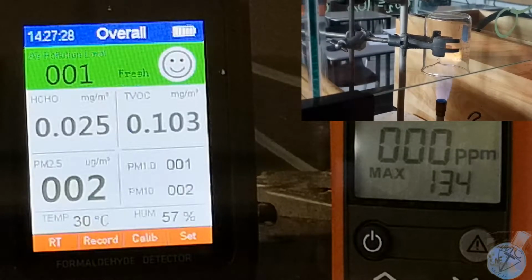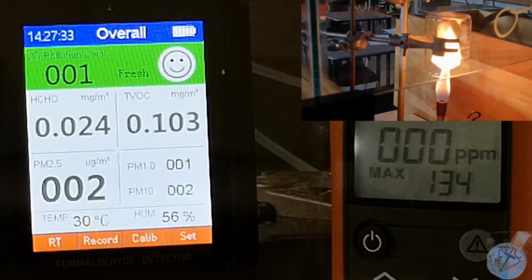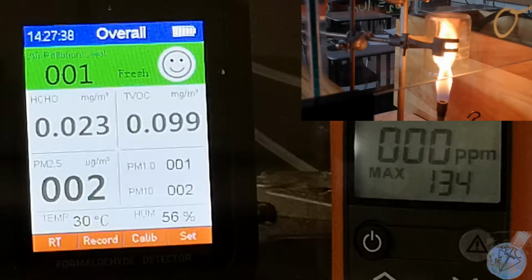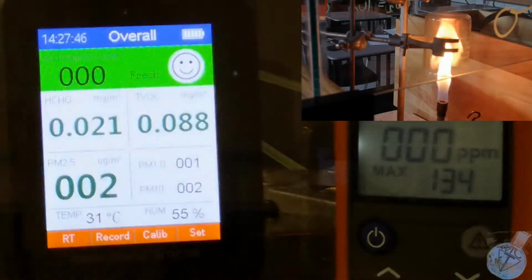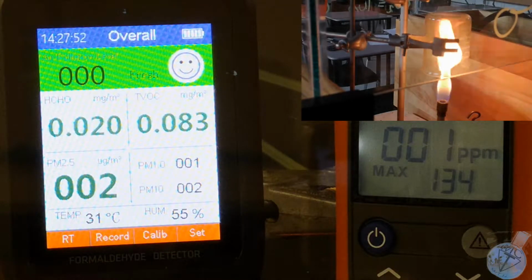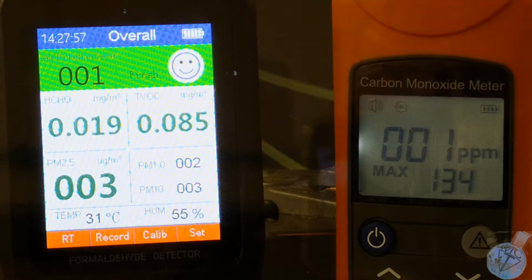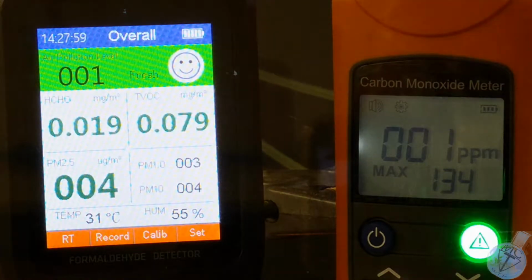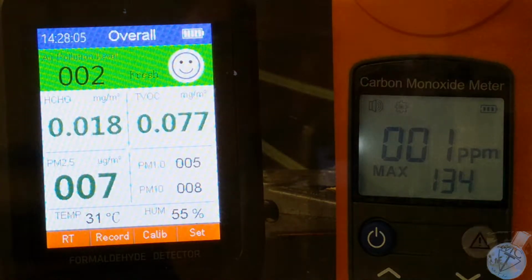Now I'm going to fully choke the flame, so it will be burning as intense of a yellow as I can get it. So virtually oxygen-free flame, which makes it highly polluting. The autofocus is having a bit of trouble because there's actually heat waves in the tank now. So it's only been about 10 seconds, and already we're seeing carbon monoxide production taking place in the box.